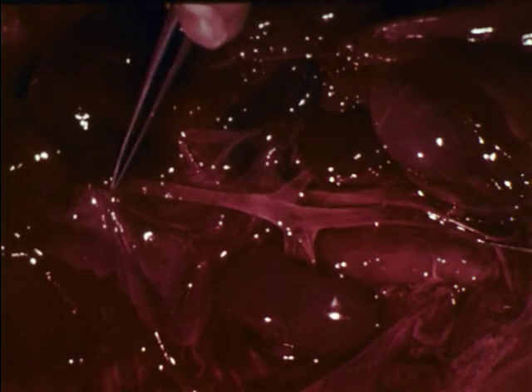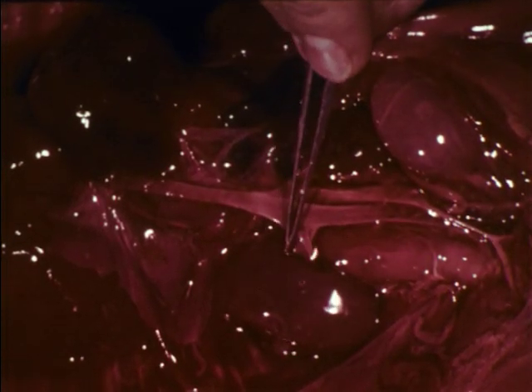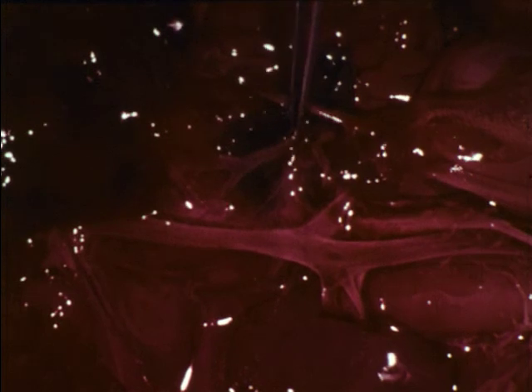Blood returns to the heart through the systemic veins. The large posterior vena cava receives blood from all parts of the lower body regions. For example, the renal veins empty blood from both kidneys into the posterior vena cava. The portal vein carries blood from the digestive tract to the liver. In the fetus, blood from the placenta flows through the umbilical vein, which also enters the liver.